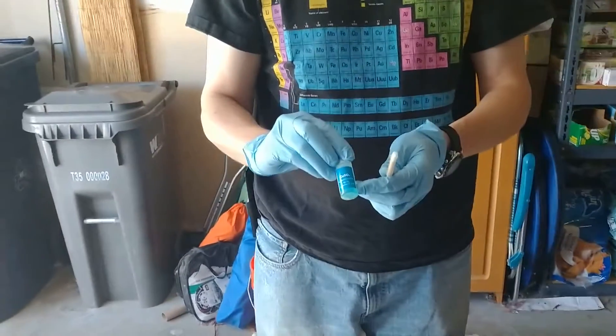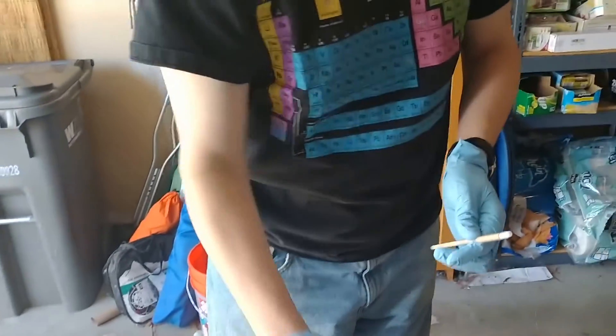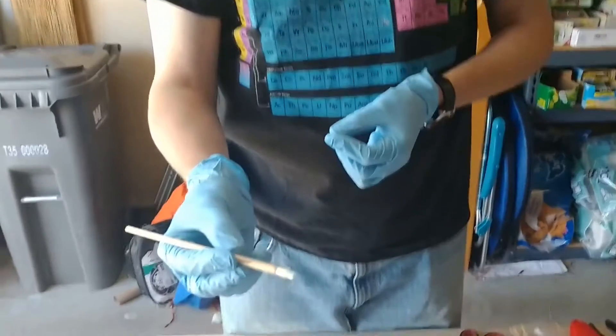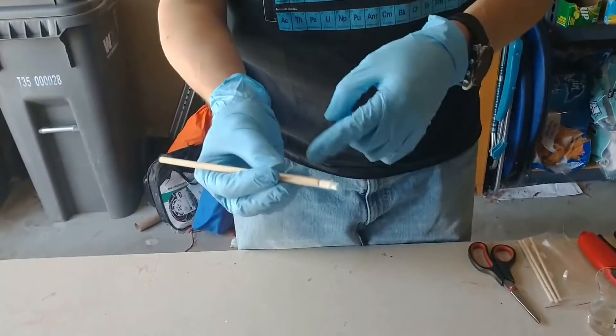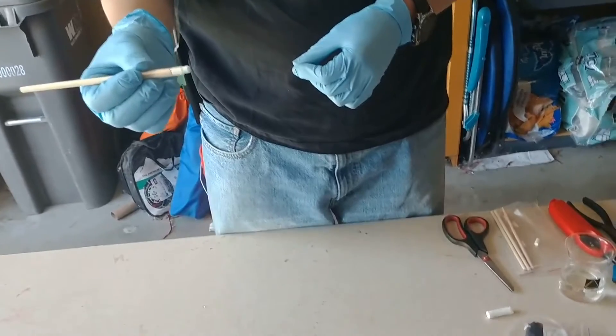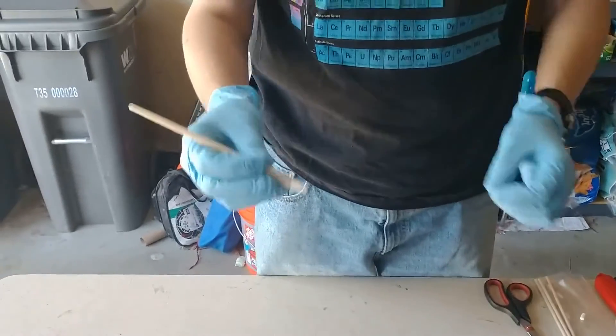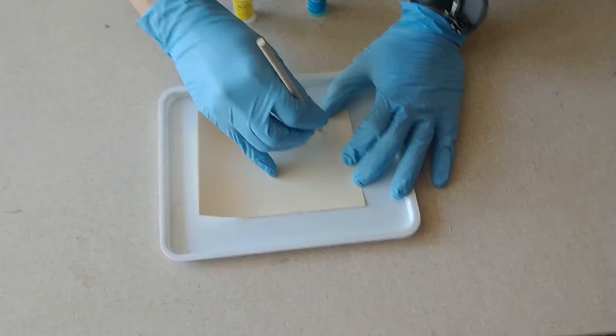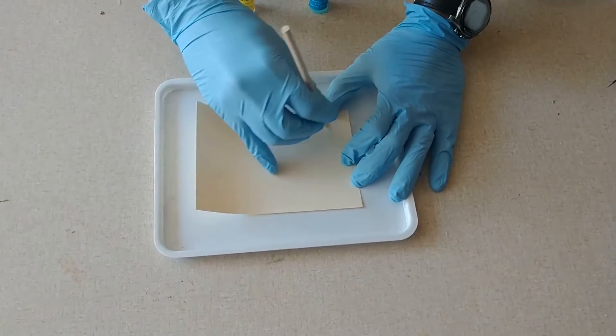Doesn't take a lot. We've seen copper sulfate a number of times — very pleasant little blue color. And as we can see, it's really soaked into that cotton tip here. I'm going to make a crude representation of my school's mascot, a raven.